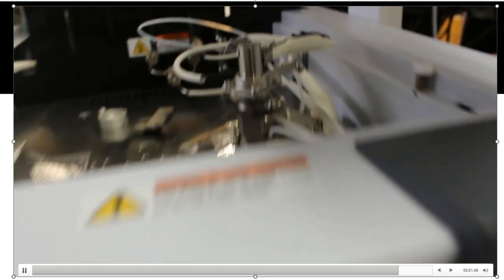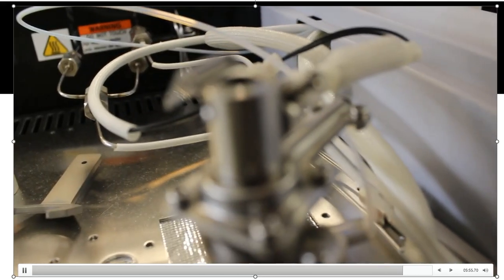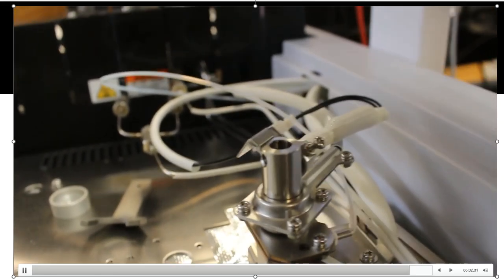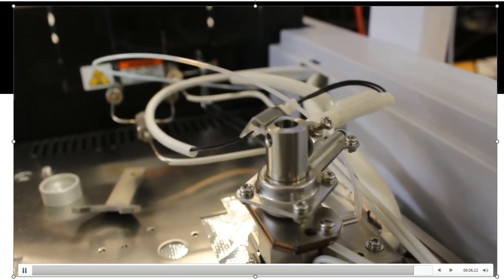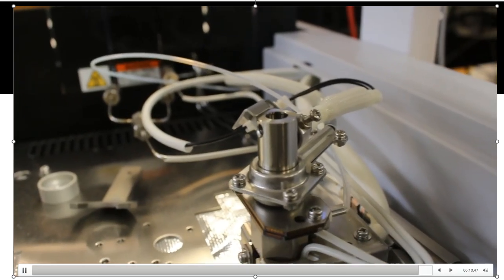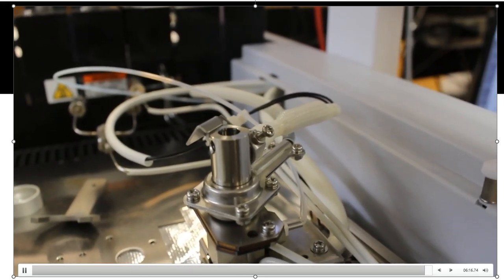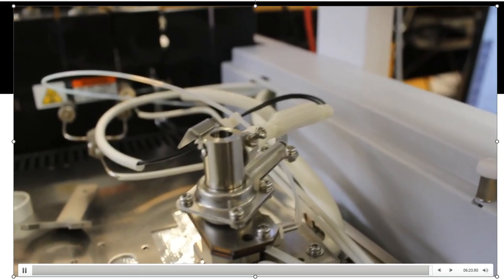And then my detector is this little chimney stack right here. That is my detector. Oh, yay, look. Now you can see why I call it the chimney stack. A large amount of heat is coming up from the top. I can feel it because there's a flame on the inside. And that's how it actually destroys these organic compounds like alcohol, and it is able to pick up signals after it destroys them. It ionizes them, and that's why it's called a flame ionization detector.